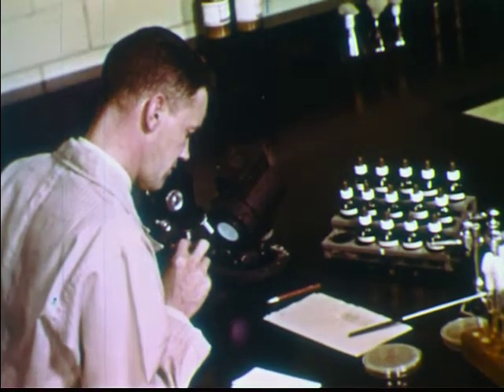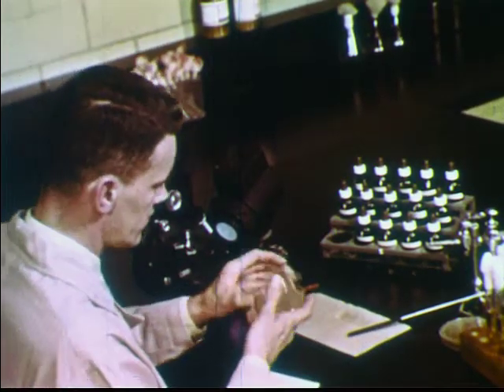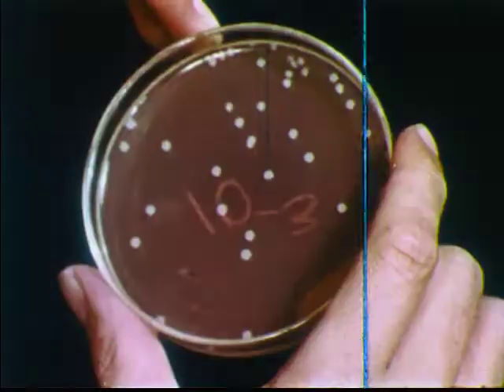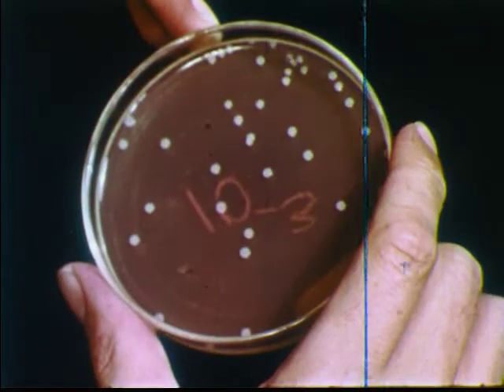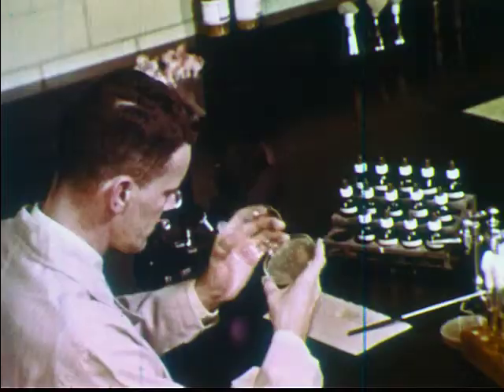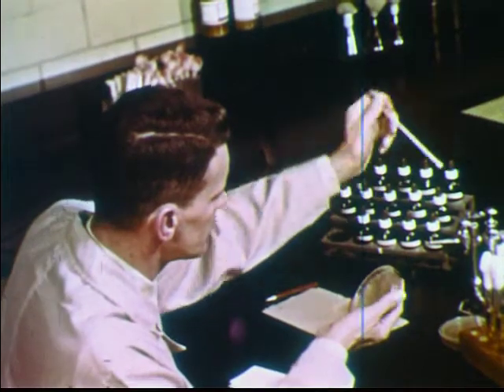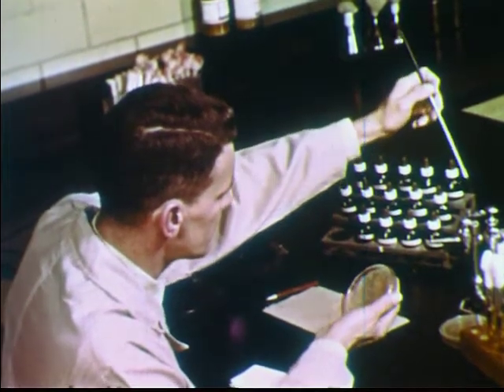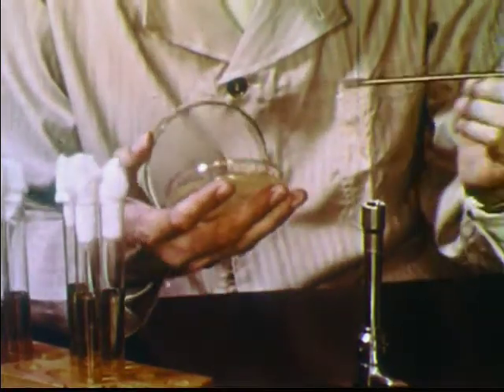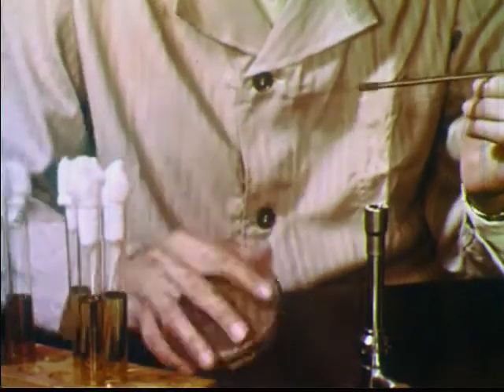Even though bacteria are extremely small in size, we have seen that methods have been developed for studying their characteristics and activities. Using these and similar techniques, man has learned not only how to control bacteria, but also how to utilize their desirable actions in his own service.